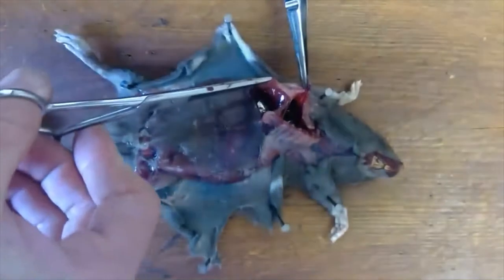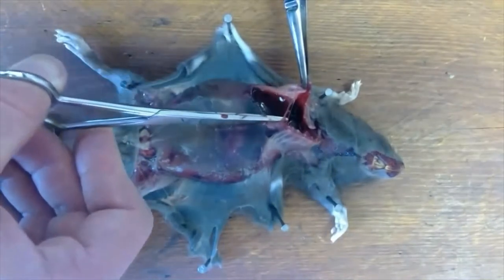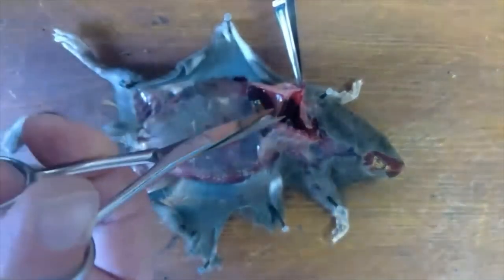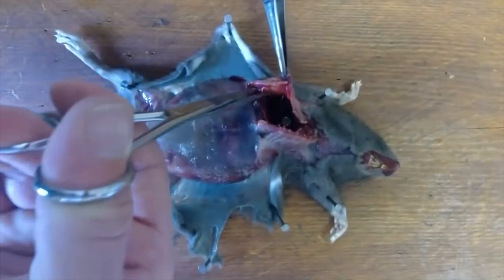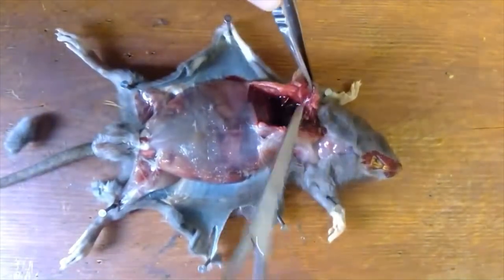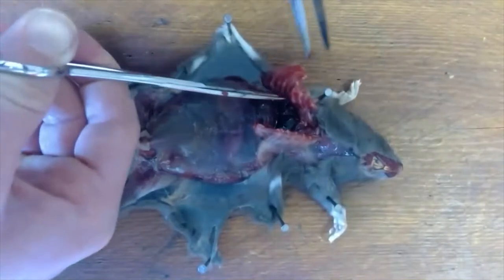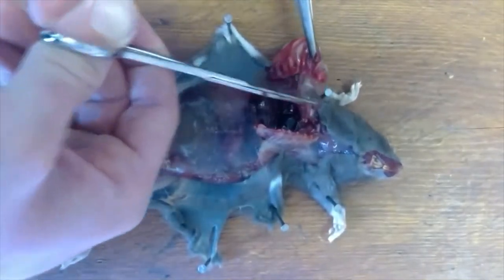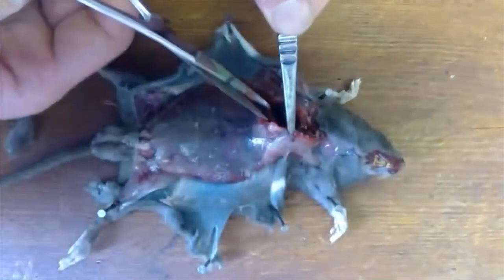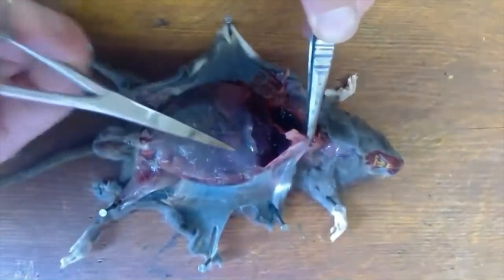You can just make out this membrane here — that's actually a muscle, which is the diaphragm. You can just about make out the boundary, which is quite nice. The diaphragm contracts and flattens when you breathe in. One good thing about working with a rat is you can do this with scissors — if you're doing this in a human, you need a big hacksaw to do the ribs. And you can really see the diaphragm quite well now.